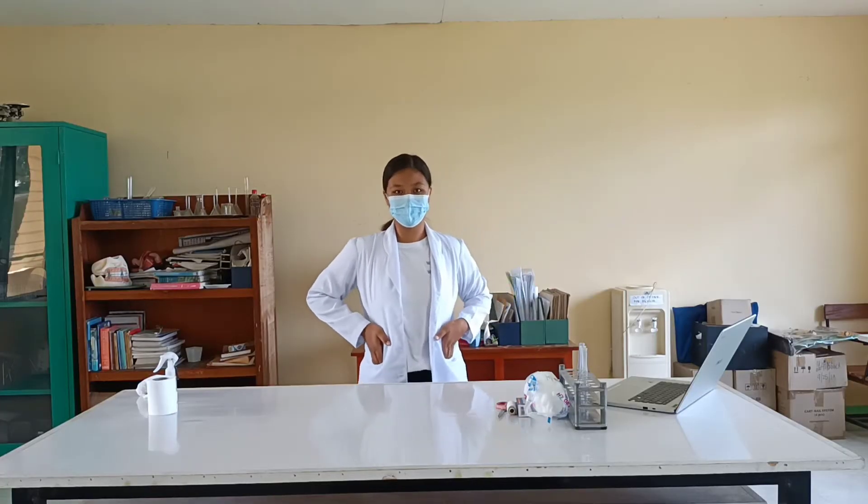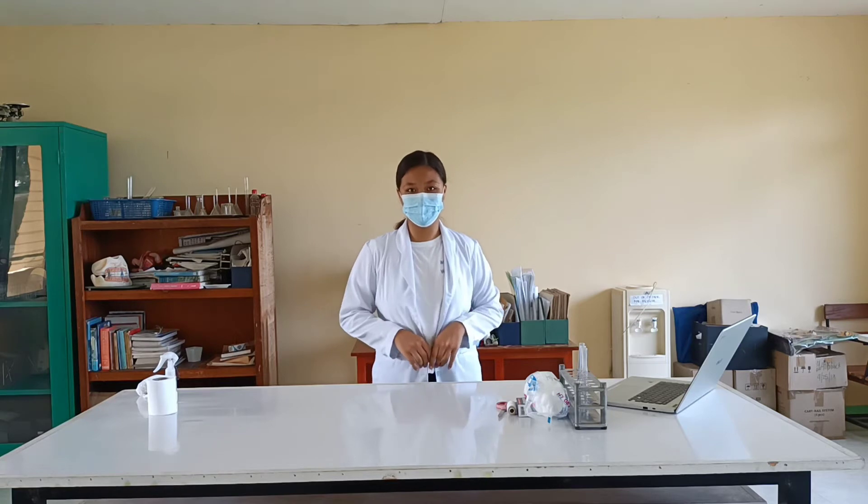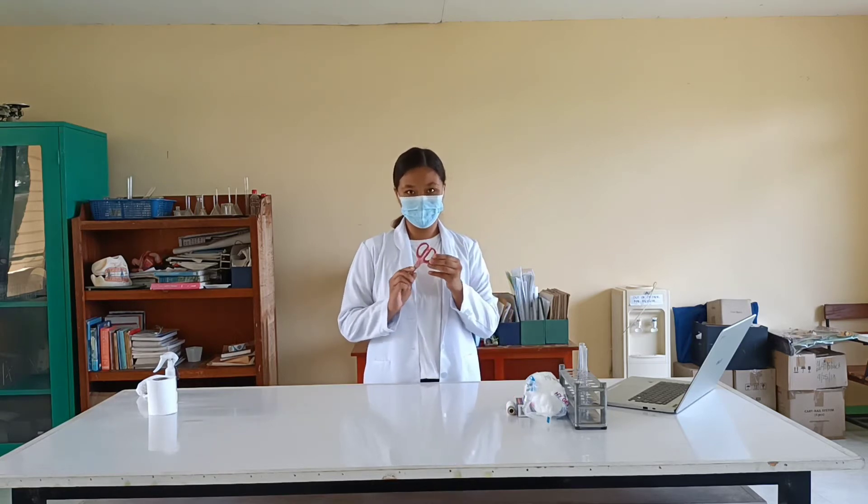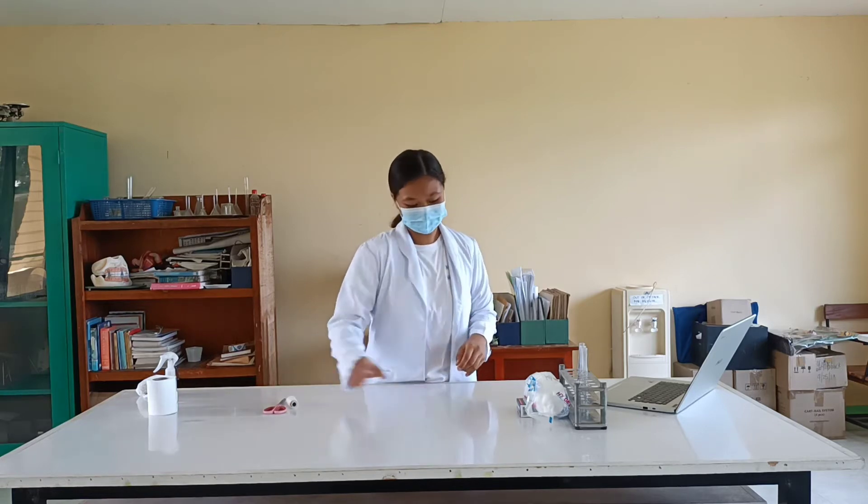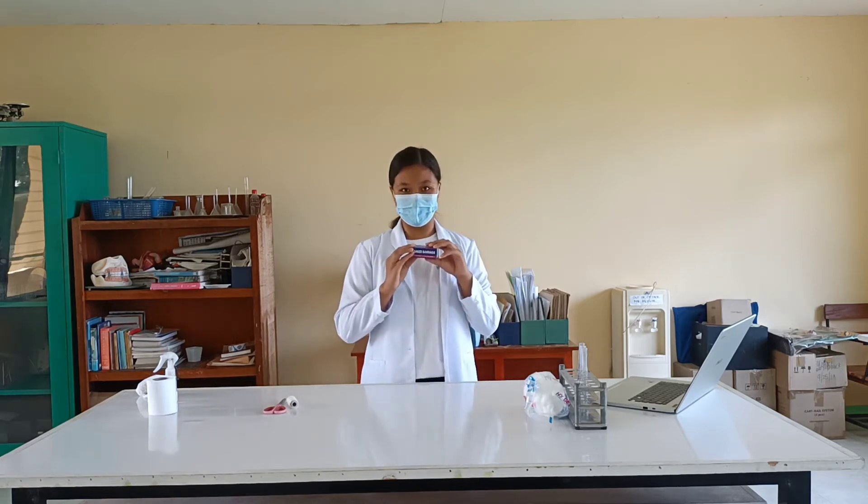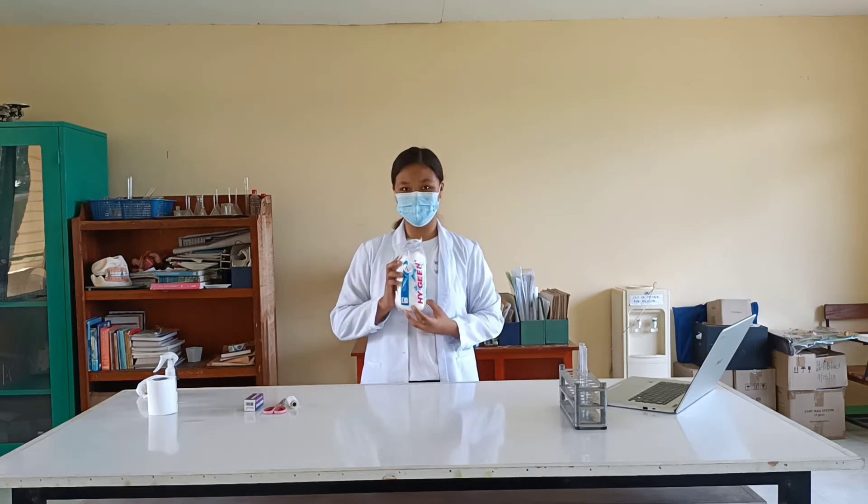When we are going to make it in front of the burner, we also need to make cotton plugs for test tubes. We need a pair of scissors, a thread, a gauze bandage, and of course the cotton.